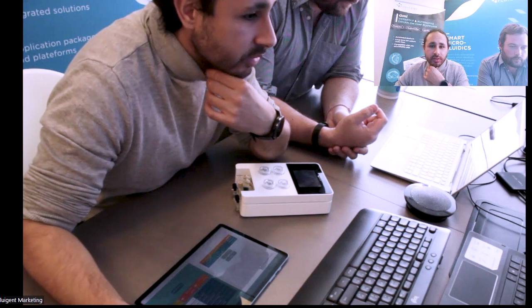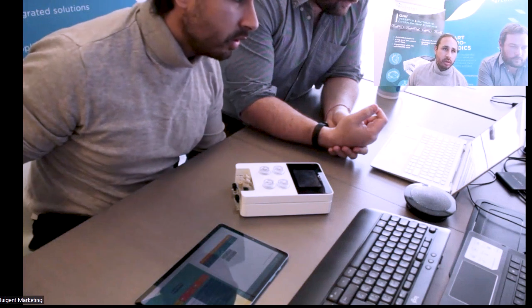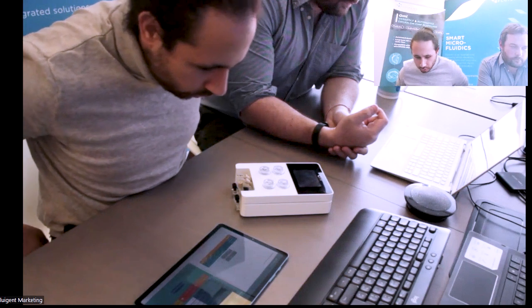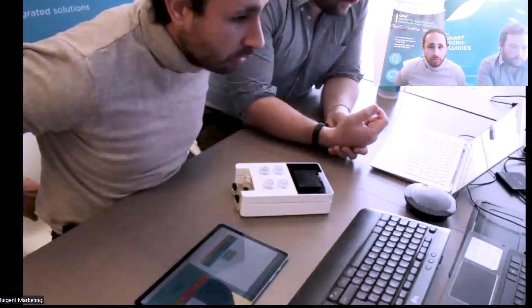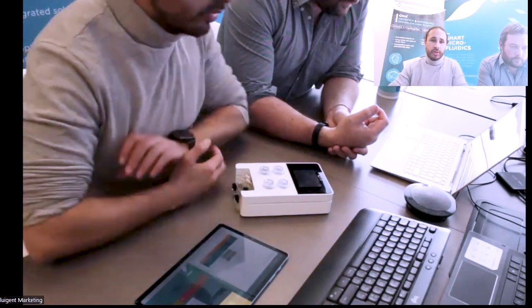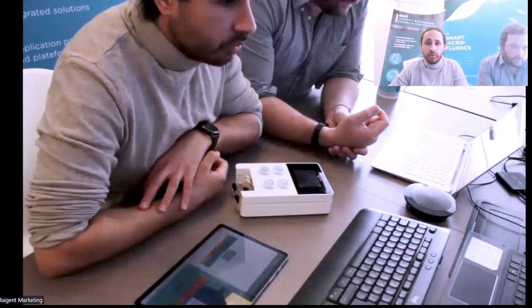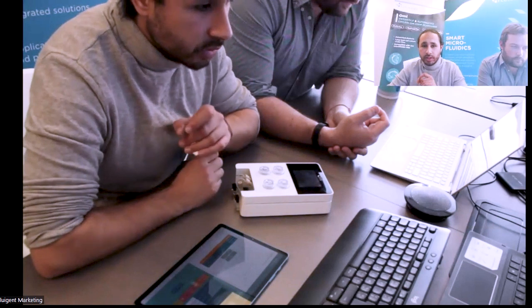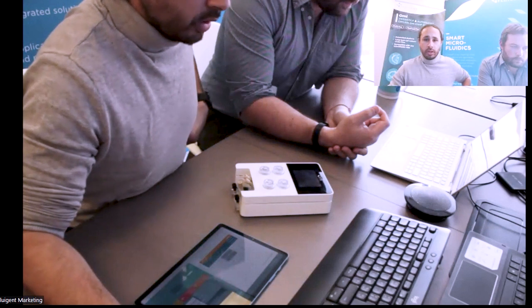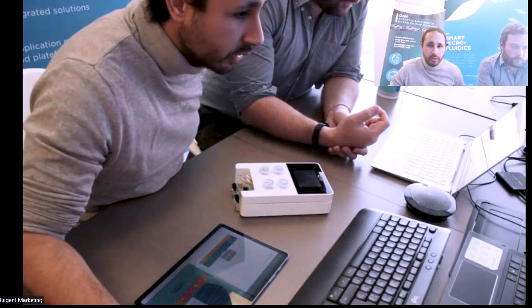Using what type of cells did you test with OMI? For the moment, we have worked on different types of cells. We have a beta tester who has worked mostly, let's say, on endothelial cells to create blood vessels on chip. We have people who are working on CTC or recirculation as well. And we are still working on it with some partners on the blood vessel.